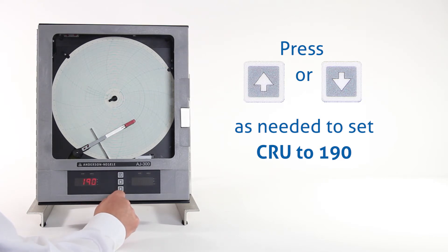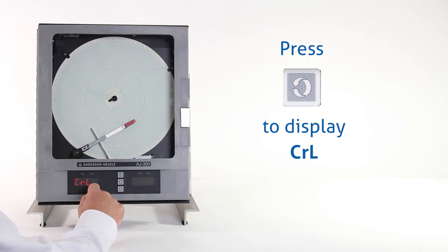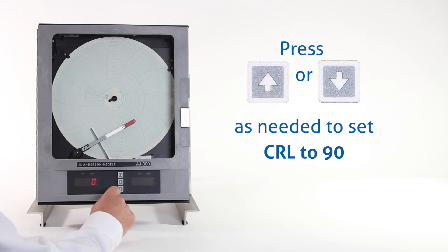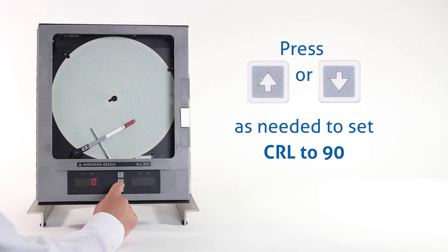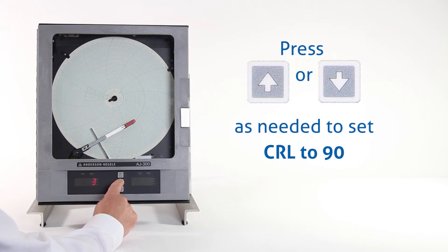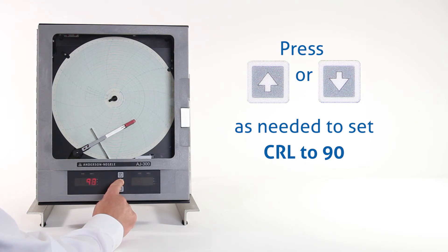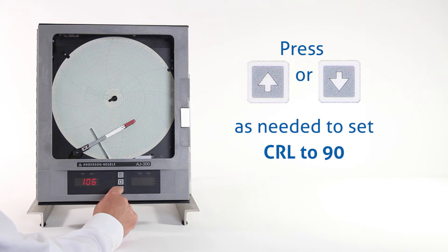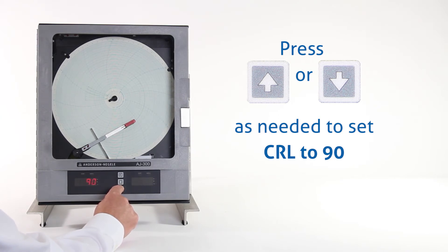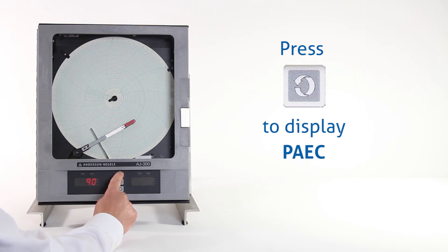Once we have that on the display, press the scroll key, and we'll see CRL — that's for chart range lower. Scroll again, and that value's at zero. We want to run that up to 90, so we can press and hold the up arrow key. The longer you hold it, the faster it'll go. If you happen to go past it, you can use the down arrow key to bring that back down to 90. Once we have that set at 90, we hit the scroll key one time.